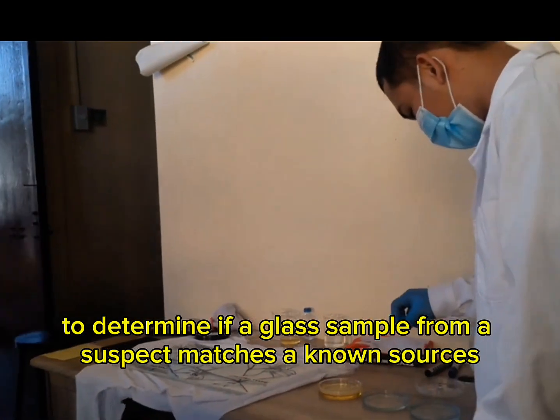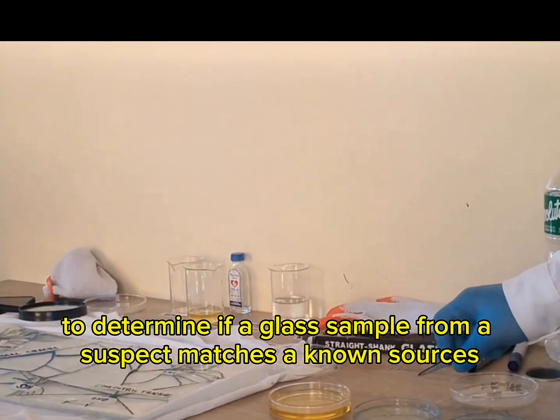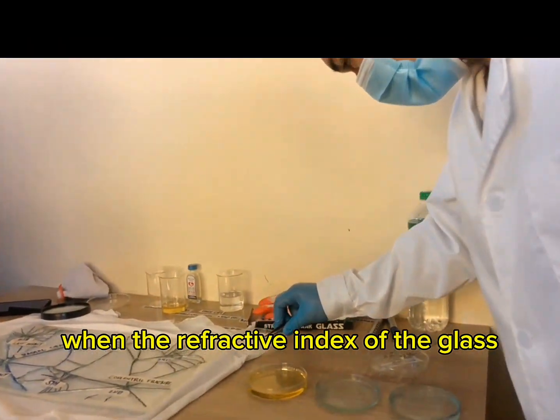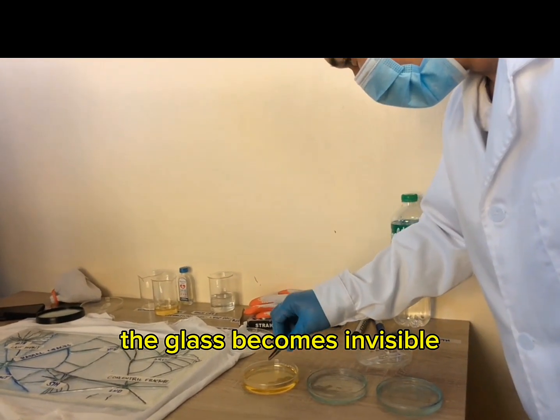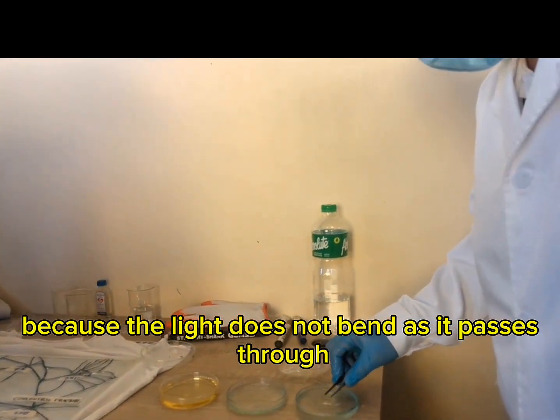To determine if a glass sample from a suspect matches a known source, we look for the Becke line to disappear when the refractive index of the glass and the liquid match perfectly. The glass becomes invisible because the light does not bend as it passes through.